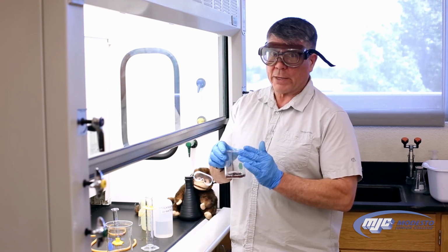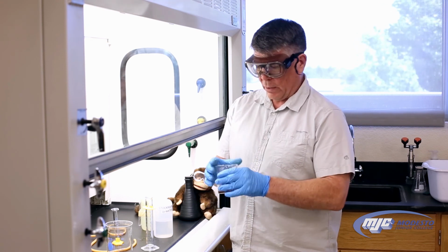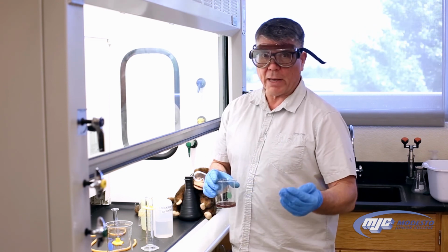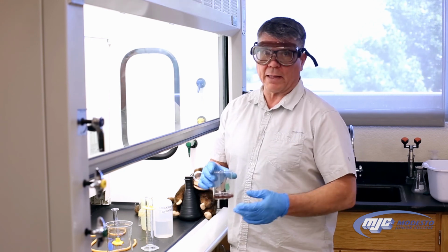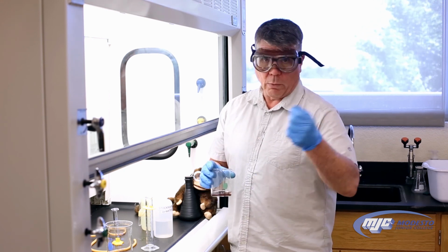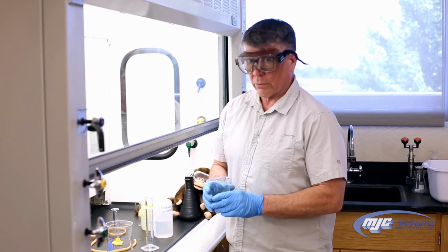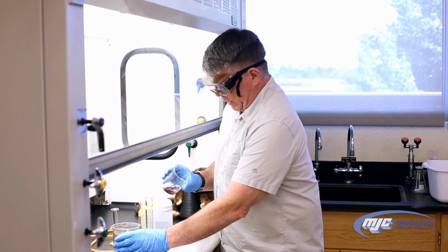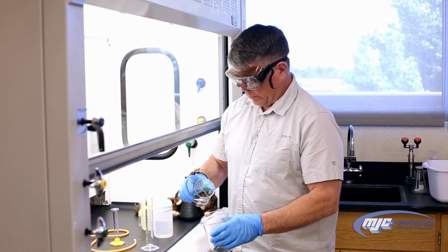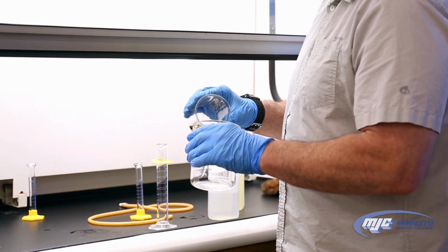Because we weighed the beaker in the beginning, all we have to do when we come back is put the beaker with the dry copper in it on the balance, get that mass. Because we know the mass of the empty beaker, subtract that, and that'll give us the mass of the copper. What we want to do is find out how close that is to what we started with, law of conservation of mass. Now this waste, I'm going to pour into my waste beaker, and then later I'll put it into the organic waste container.